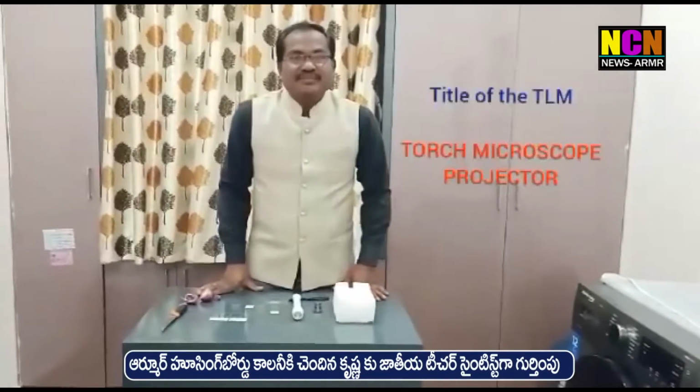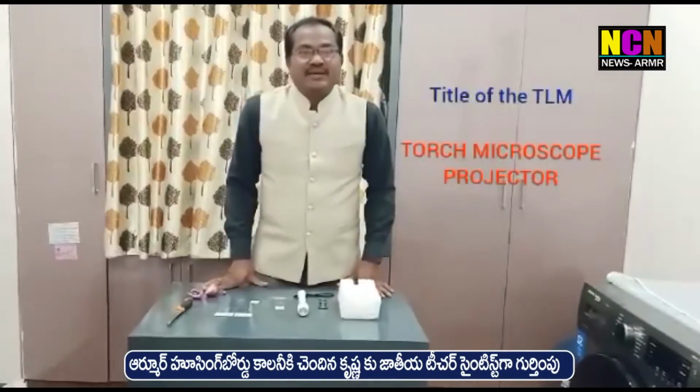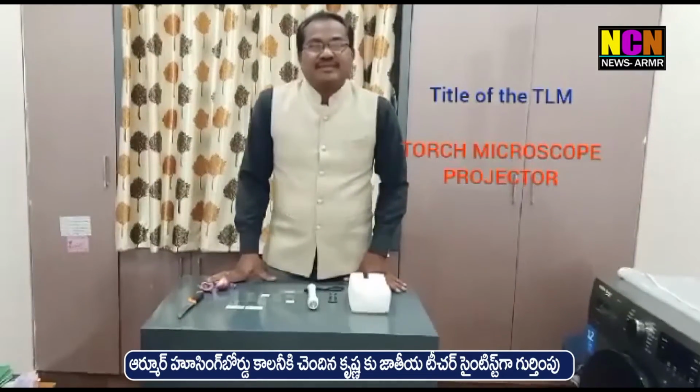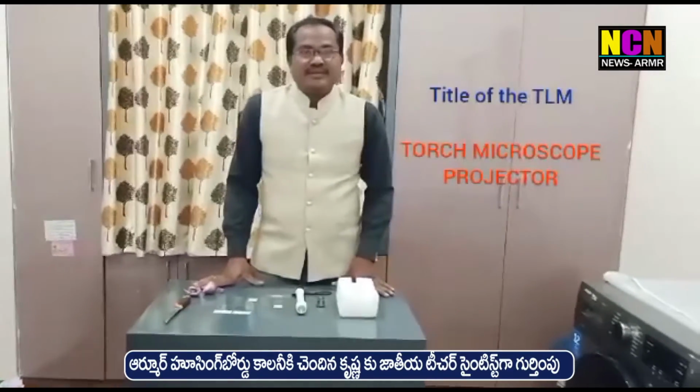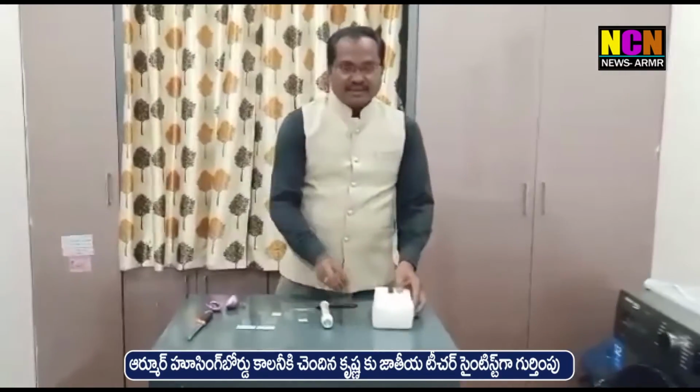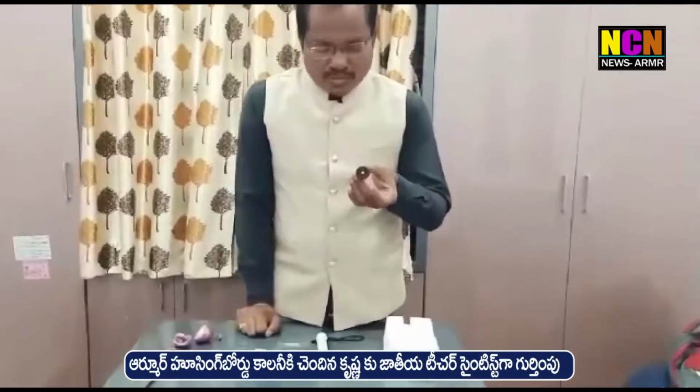Hi everyone, my TLM name is Torchlight Microscope Projector. For this we need a foam sheet, a 15x eyepiece from a microscope, a torchlight, and some slides. Then we also need an onion.